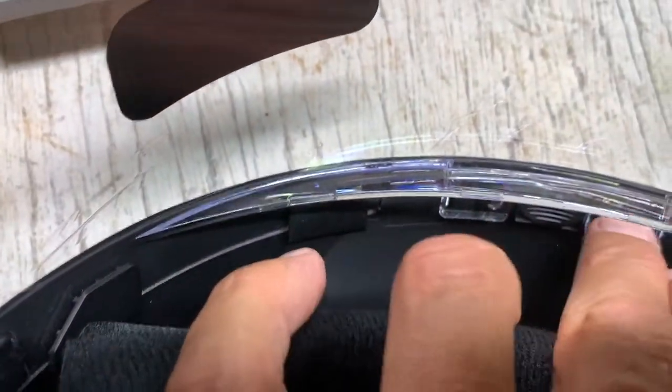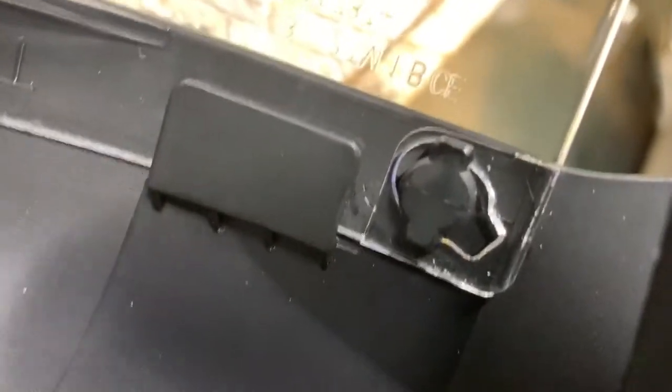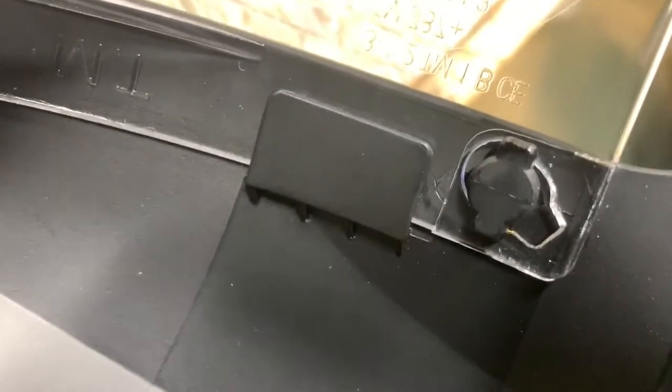So that's slid in there and those two little nodules are right there. Just got to push it a little bit more. I think they're on there — yep, almost. Looks good. See how that hooked on there? So this can come off and you can clean it. On the inside, those two little holes pop in there and it slides into these two little brackets. The first thing you have to do is get it aligned — if you pull on it, it pops right up and slides off. You've got to put it on both sides first, then slide it into the front.